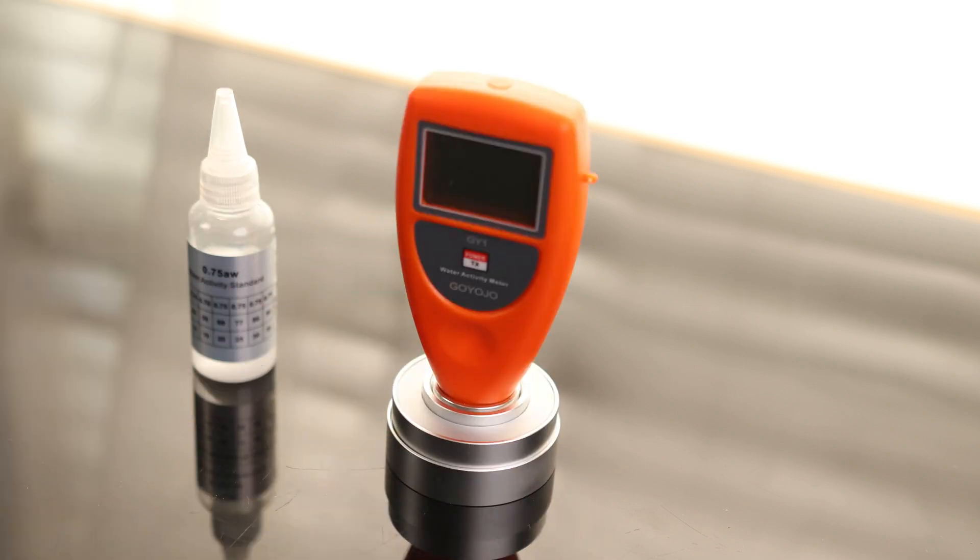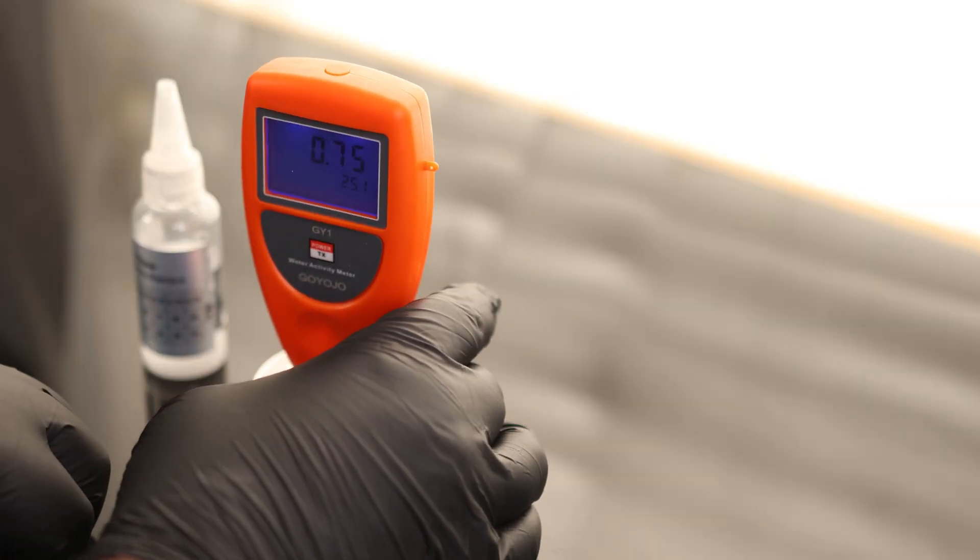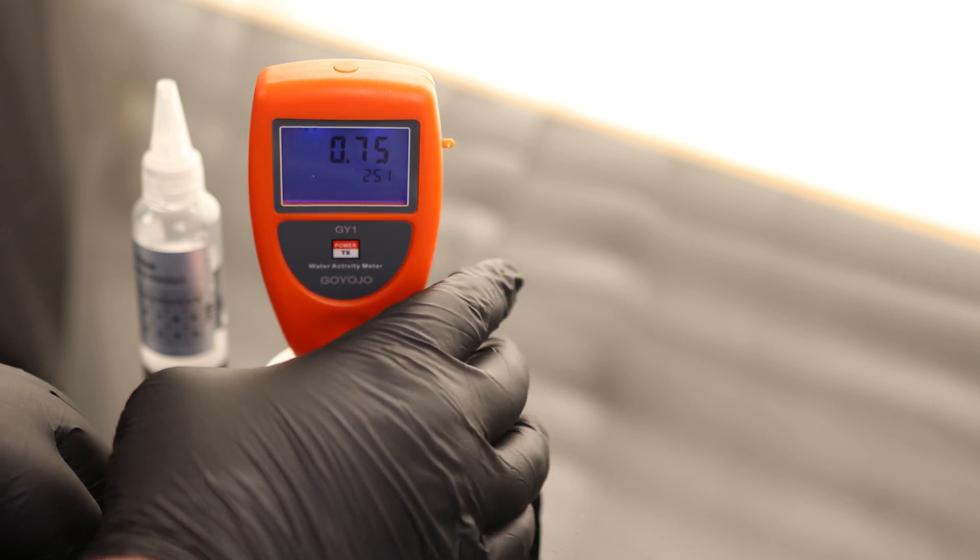We'll let that sit again and then recheck it. So let's check that again. And there we go. Perfect 0.75.